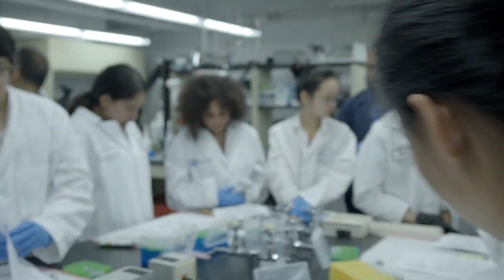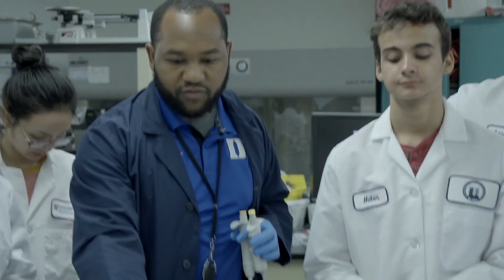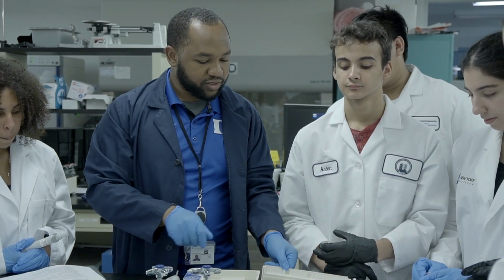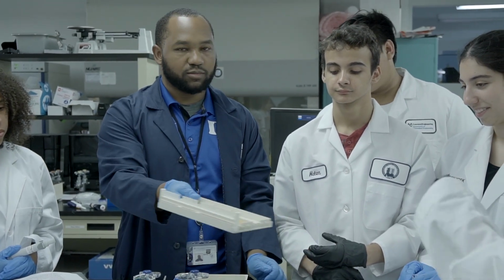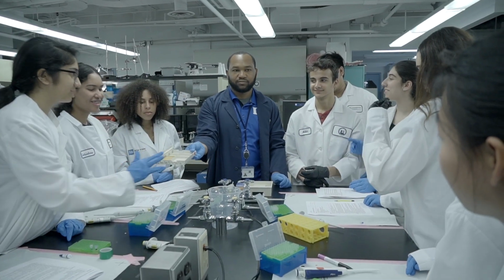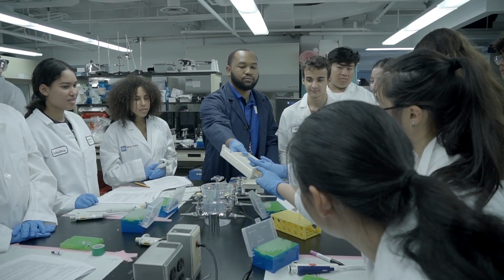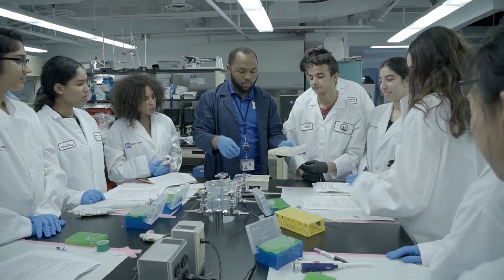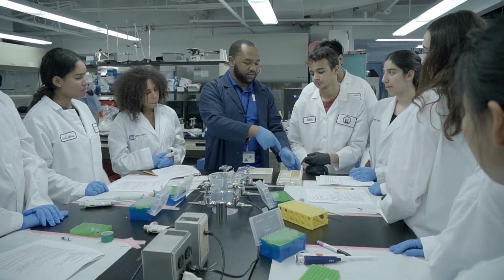All right, so you all have all your samples, right? Perfect. So next, everybody get a chance to touch this, just so you can see what it feels like. Everybody touch it. I'm not gonna bite. You'll actually be able to see once this is done running how thick the gel is. I'm going to leave it in the case again.